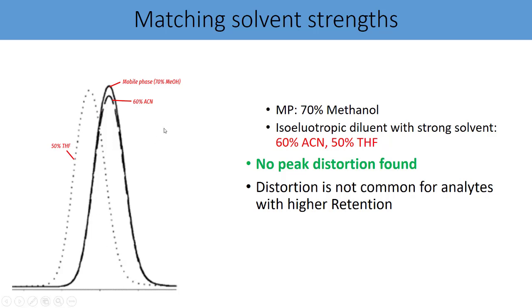Now, can you see whether there is a distortion in the peak shape, or the peak shape is perfectly alright? Here you only try to match the strength of the diluent and your mobile phase, and you have resulted in a very good peak shape. The same kind of observation can be noted even with 50% THF as a diluent. The reason is their strength is one and the same. And hence, you can conclude that in case your diluent and mobile phase strength is closer, no peak distortion will be found.